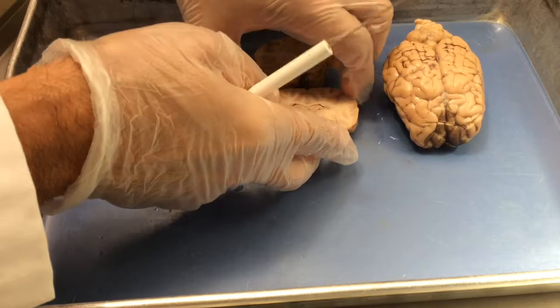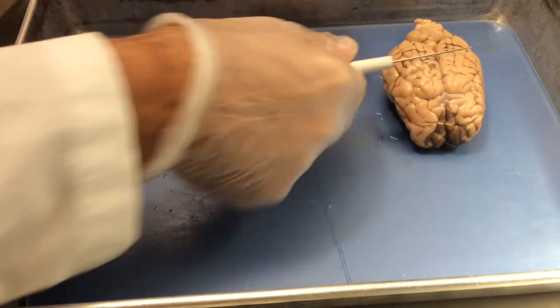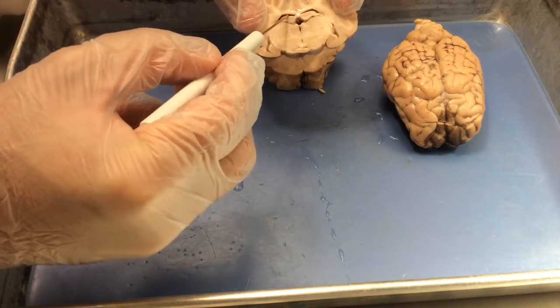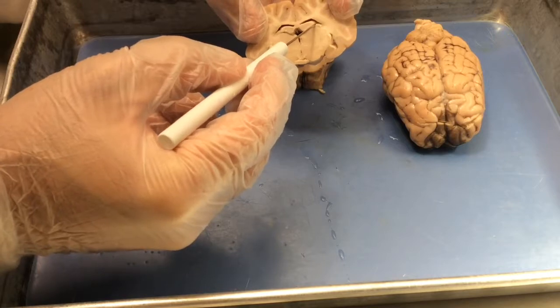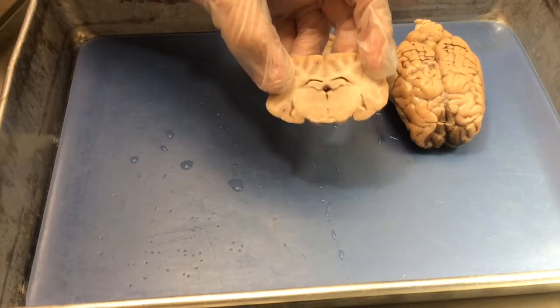The lateral ventricles still do exist, but as you move more posterior in the forebrain, the lateral ventricles appear more dorsal in the section. And so this space here and here are the lateral ventricles. If you see some brown in the lateral ventricles, which I do, those are a gland called the choroid plexus, which makes cerebrospinal fluid.